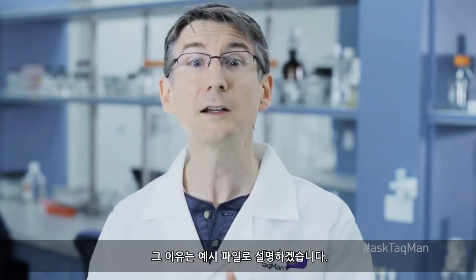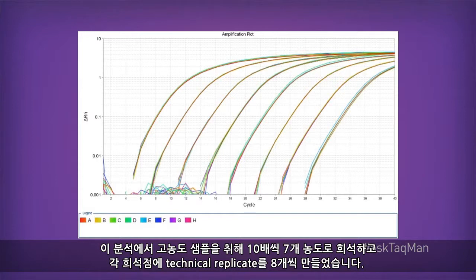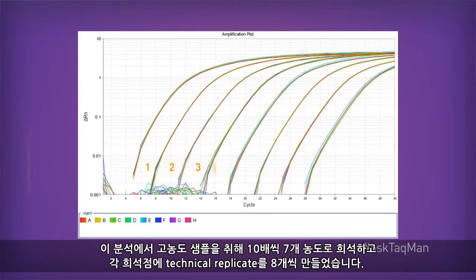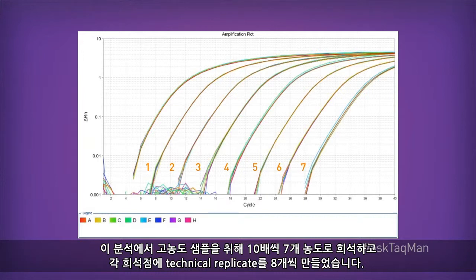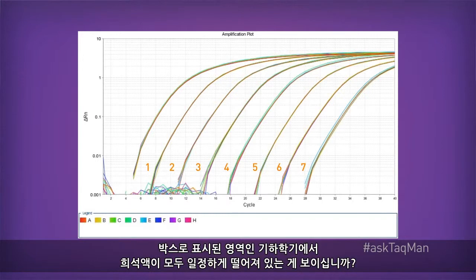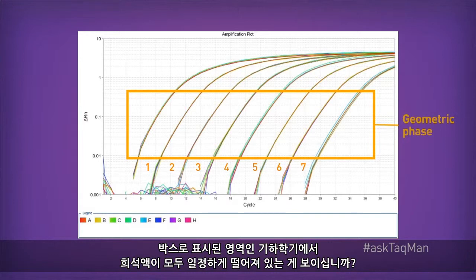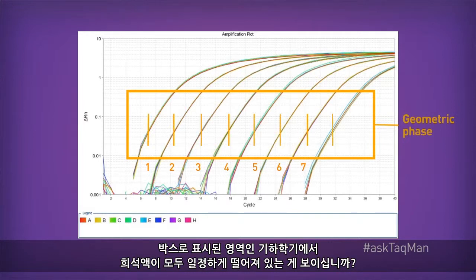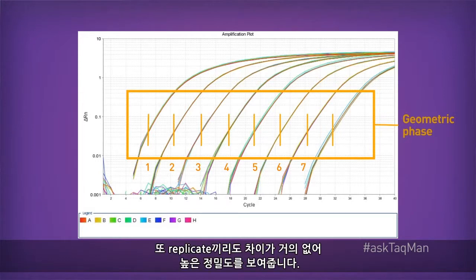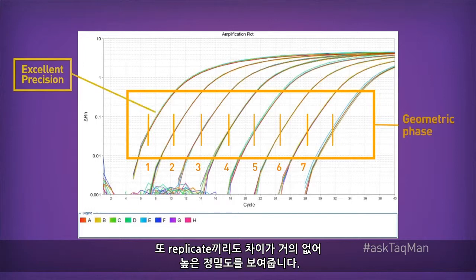Now, to see why, let's take a look at an example file. In this run, we took a highly concentrated sample and serially diluted it in tenfold increments over seven logs. We also ran eight technical replicates for each dilution point. In the geometric phase, which is approximately the area inside this box, all of the dilutions are very evenly spaced, exactly as we would expect. Also, the pipetting replicates are very tight, meaning we have excellent precision.